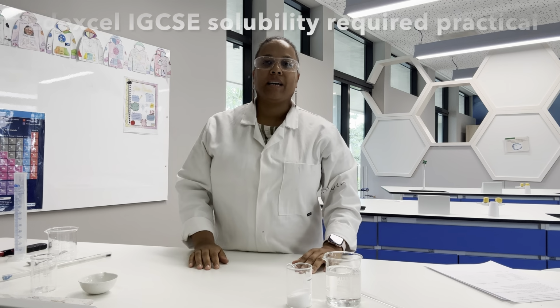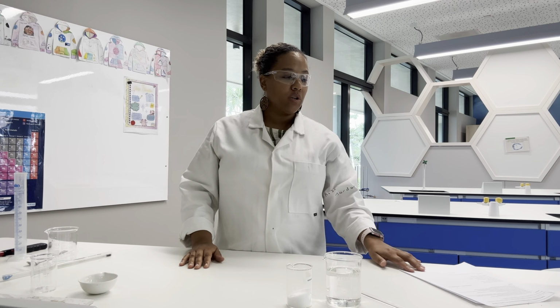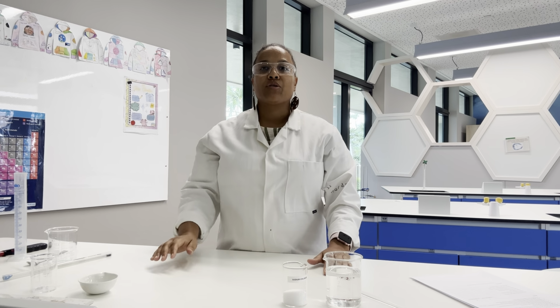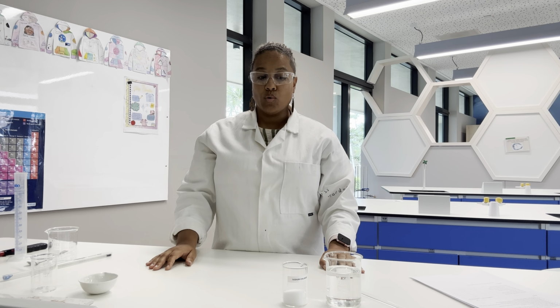Today we're going to be looking at Core Practical 1, which is the first required practical for the Edexcel IGCSE, and it's all to do with solubility. So we're going to be investigating the solubility of a solid, and today it's going to be sodium chloride in water. Now, solubility is how many grams of a solid dissolves in 100 grams of water.